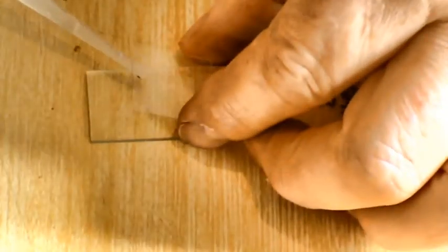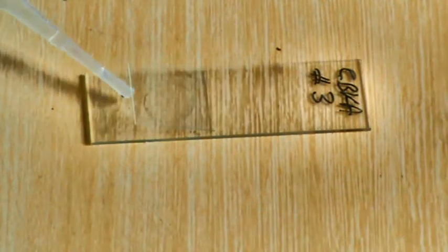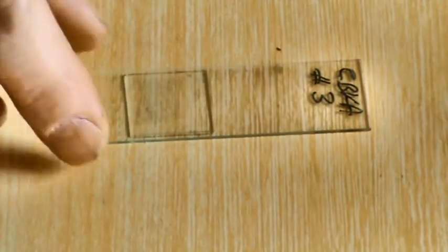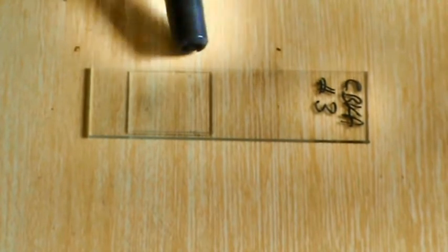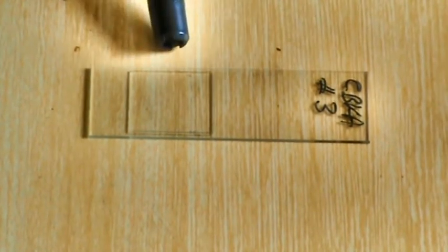We then take a cover slip. And where the drop is, we just gently place that on top. Spread out. And there we have the identity of the colony on this side. We have the cover slip, and underneath that there is a sample. So that slide is now ready for testing under the microscope at 400 magnification for the Nosema spores.